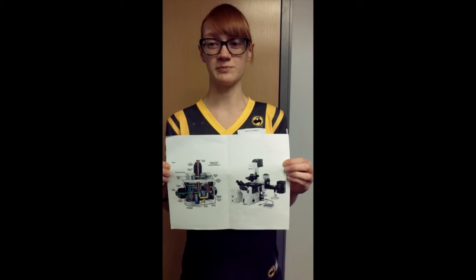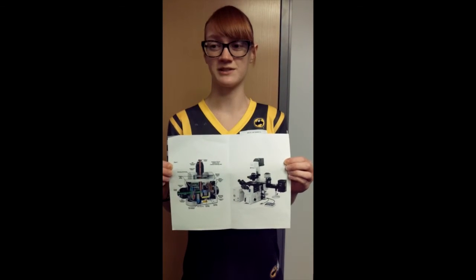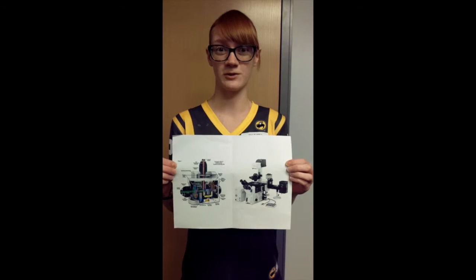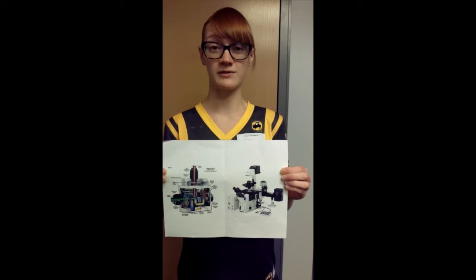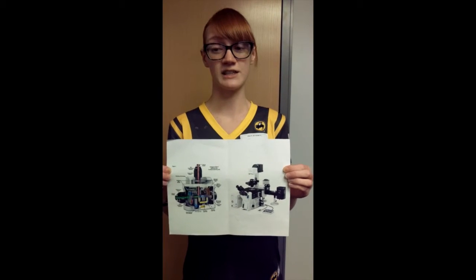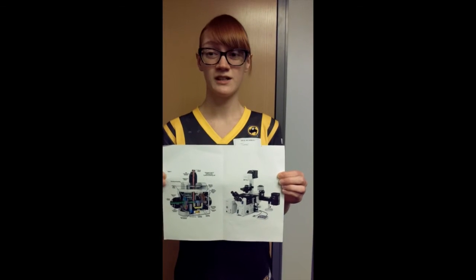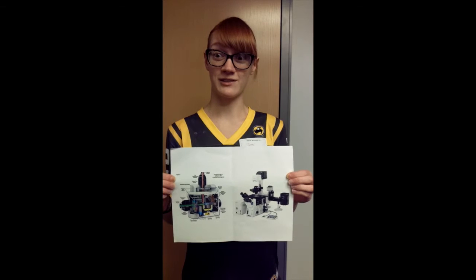Confocal microscopes use spatial filtering techniques to eliminate out-of-focus light and glare in specimens whose thickness exceeds the immediate plane of focus. It's become popular in hospitals because of the growing number of applications it has in cell biology that rely on both fixed and living cells and tissues. Confocal technology is proving to be a major advance in optical microscopy.